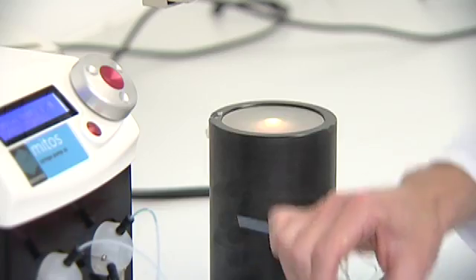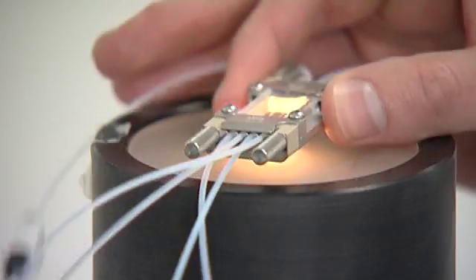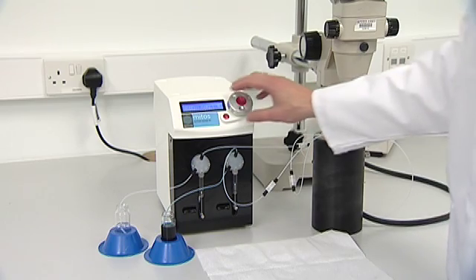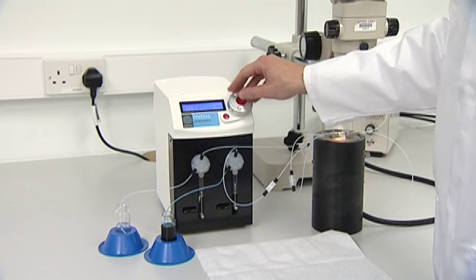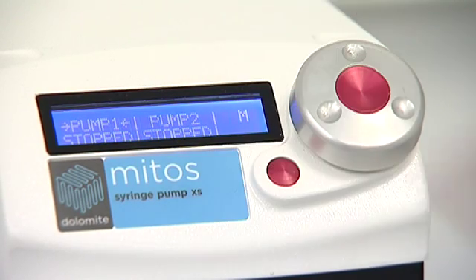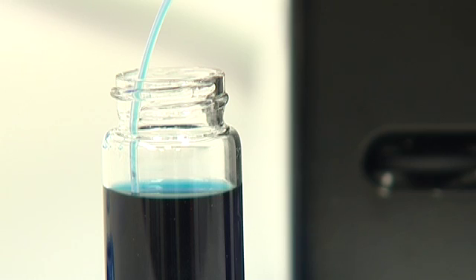This creates a pressure tight seal. The connector seals to 20 bar and is highly chemically resistant. Now that the fluidic system is complete, the pump is switched on either from the front panel or controlled by a PC. Fluid is pumped at the desired rate.